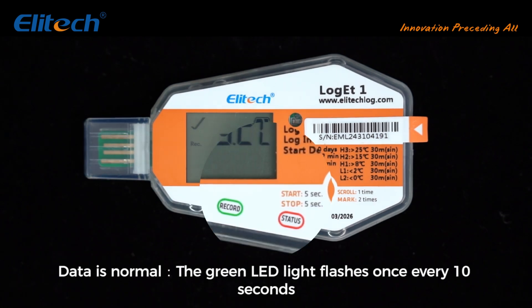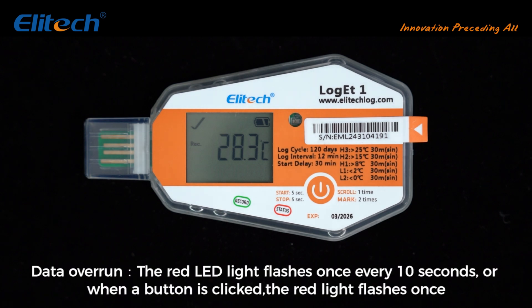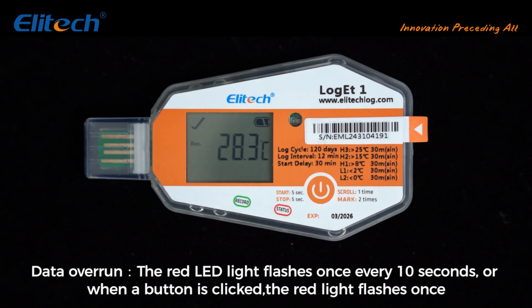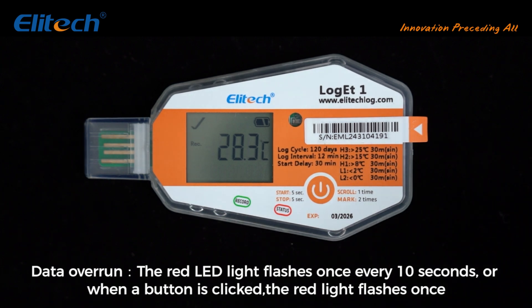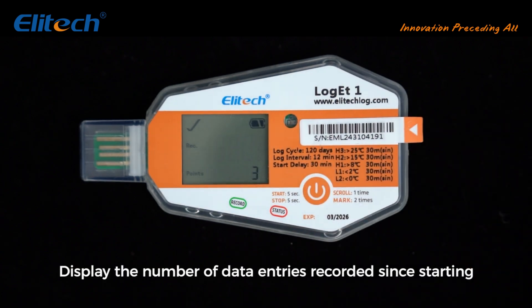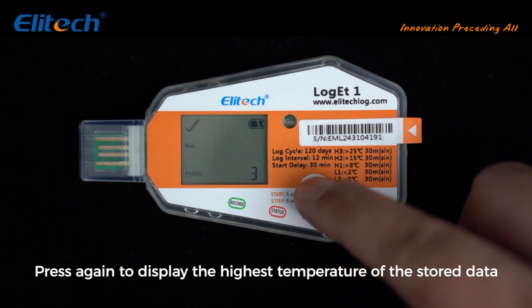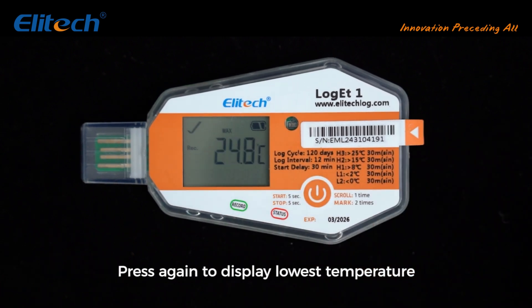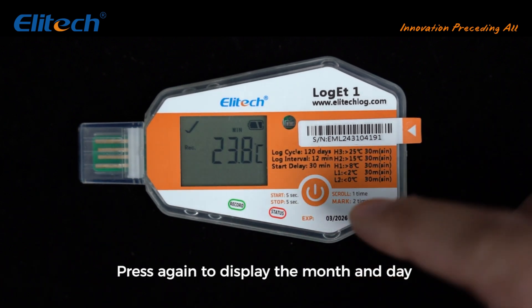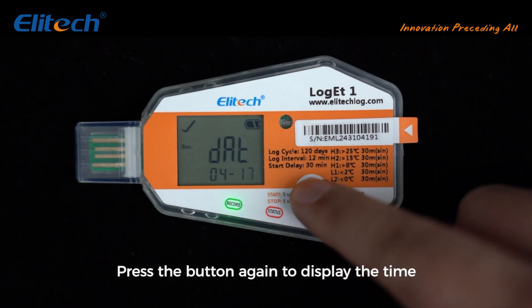When data is normal, the green LED light flashes once every 10 seconds. When data is overrun, the red LED light flashes once every 10 seconds. When a button is clicked, the red light flashes once. Short press the button to display the number of data entries recorded since starting. Press again to display the highest temperature, press again for the lowest temperature, press again for the month and day, and press again to display the time.